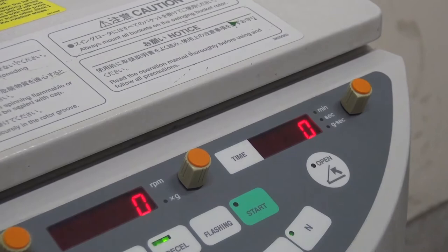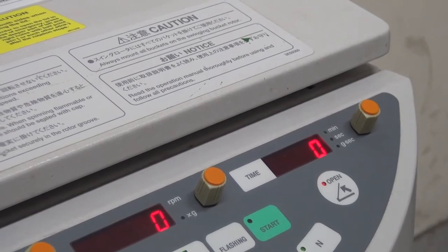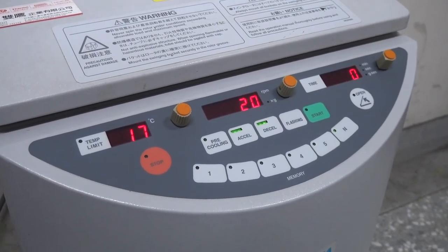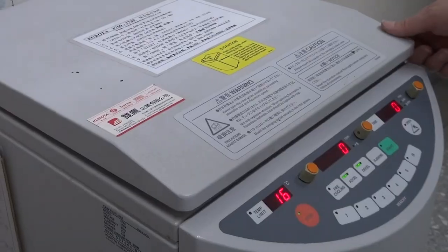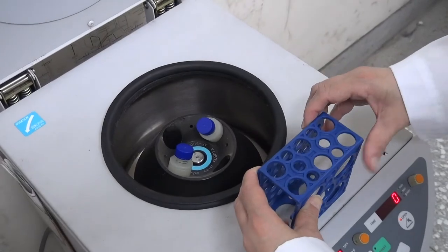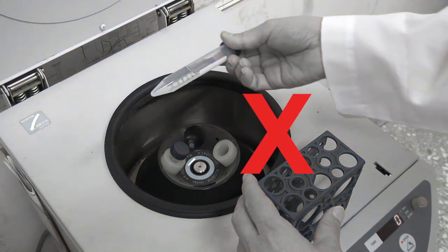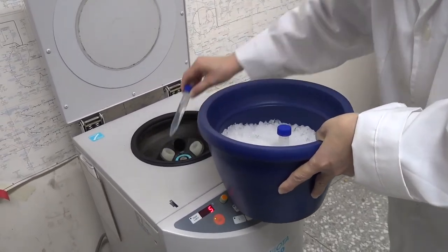Press the open lid button only after the rotating speed has reached zero or the panel shows the letters END, then open the centrifuge's lid to examine the condition or to take out the samples. After centrifugation is completed, the rotating speed will return to zero and only then can the open lid button be pressed. If the rotor has a cap, also open the rotor's cap. Carefully take out the centrifuge tubes and place them on the centrifuge tube rack to avoid shaking and disturbing the sediments. If the samples must be kept in low temperature, an icebox must be prepared before taking out the samples.